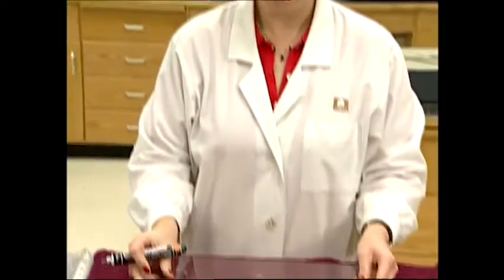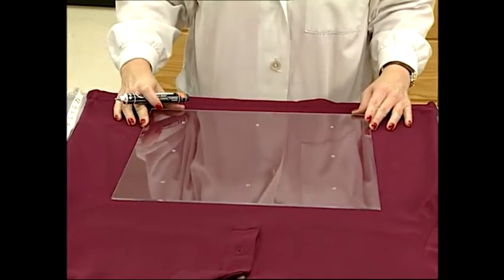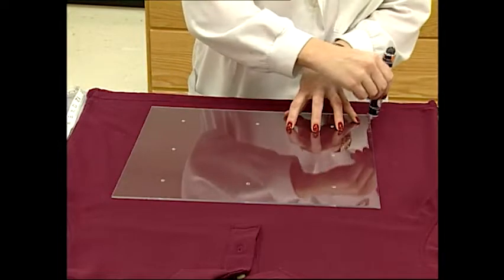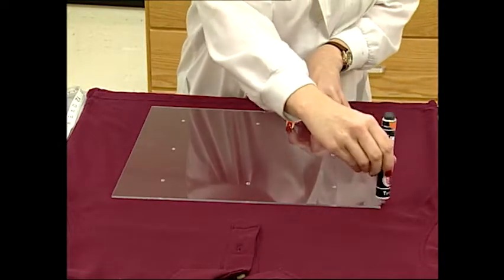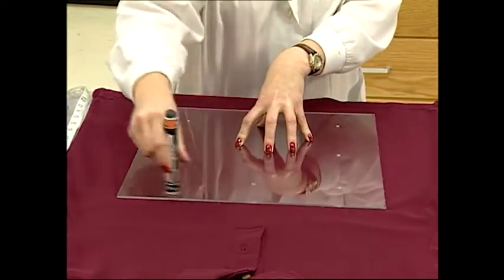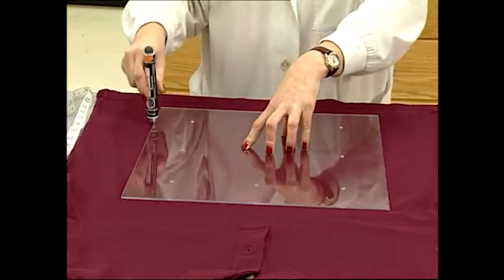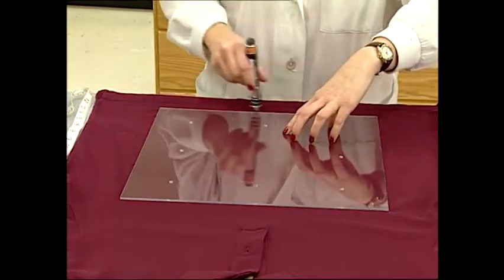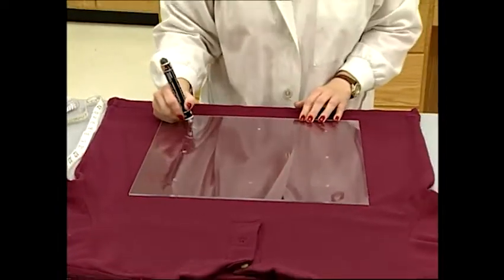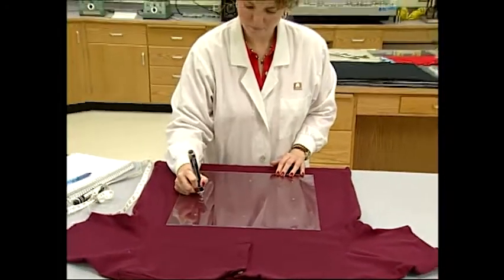If the area of the garment allows for it, 18-inch benchmarks may be placed on the front or the back of the shirt, starting above the hem and just below the neck, at least one inch from all edges and seams. If the size of the shirt prohibits an 18-inch mark, then a 10-inch mark can be used.